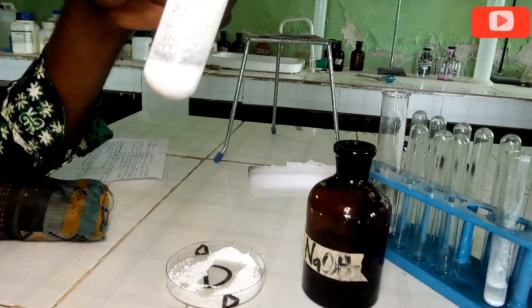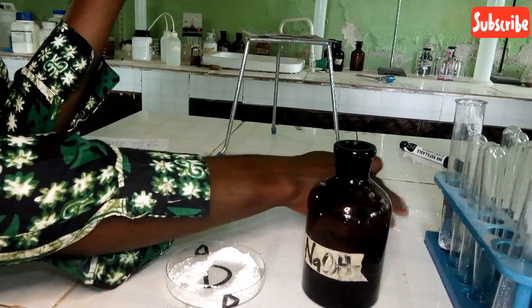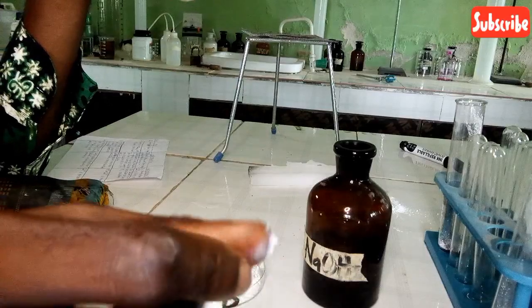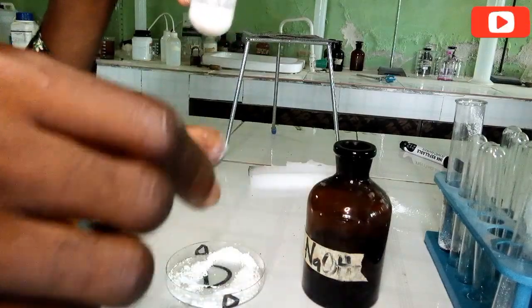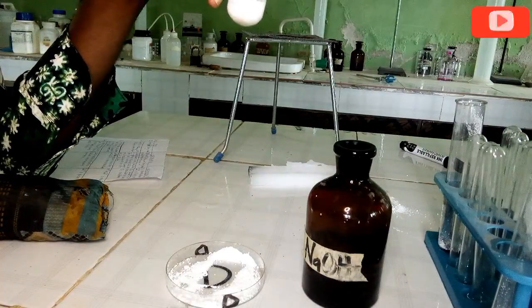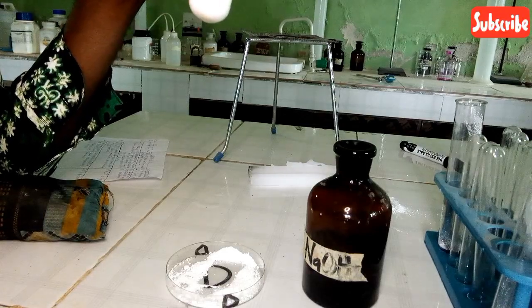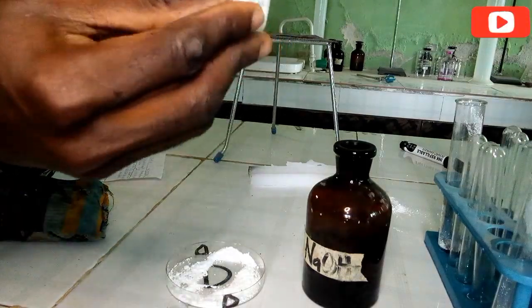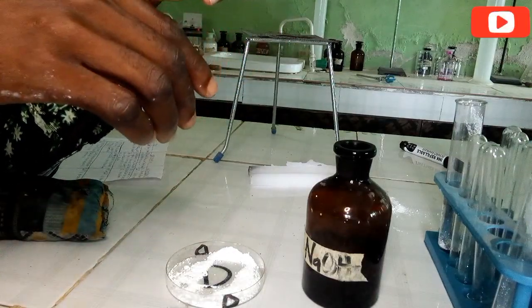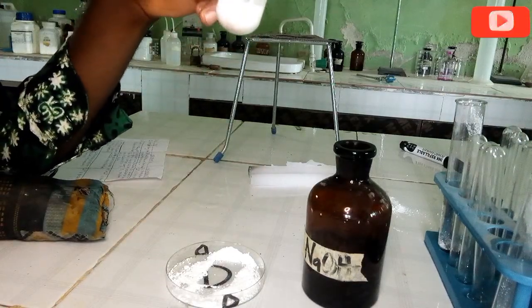So for the first one, sample D plus strong heat, it turns yellow. Now it has turned back to white as it cools. So this shows that zinc might be present. The substance might be thermochromic. Then we added HCl and it forms a solution, which we divided into two. The HCl solution is exothermic because it feels warm. When we added NaOH, there is a white precipitate, which later dissolves in excess. So the inference is either aluminium or zinc is present.